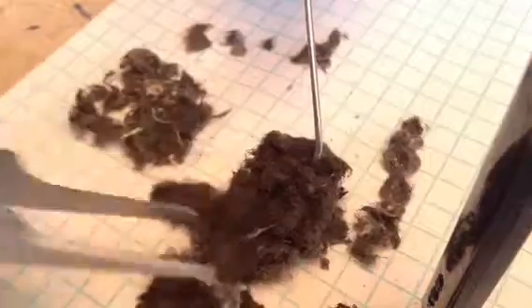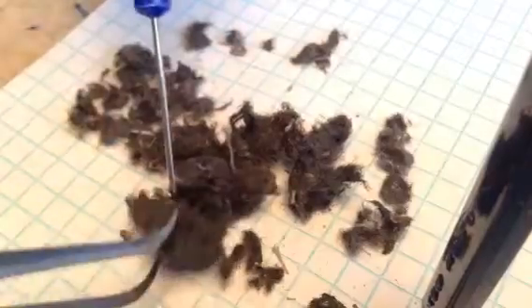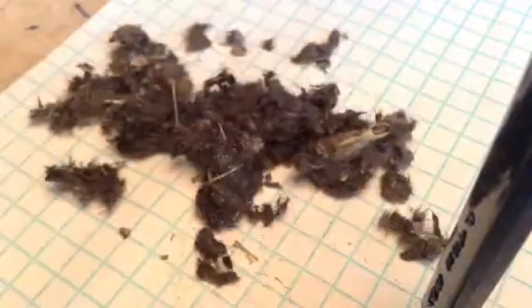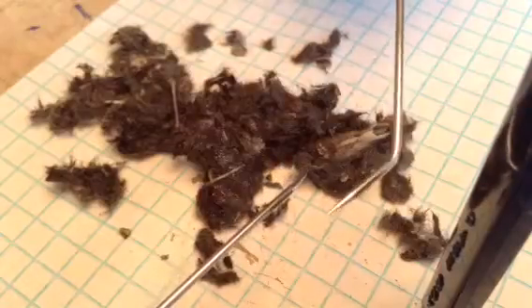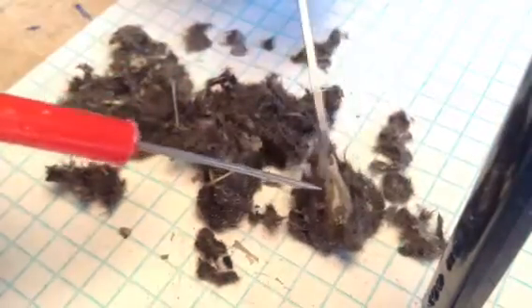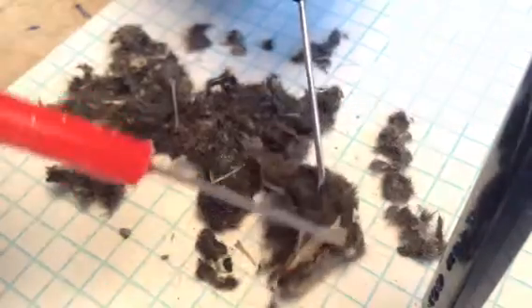Let's unwrap it. Flip this over. And again, every statement that I'm making here is not — or may not be — accurate, as I've yet to research this. I knew a little bit. Find that skull again — here it is. I'm going to use two picks for this one: a slanted pick and a straight pick. The picks are very good for getting out little details in the bones. It looks like that is a complete skull — jaws still intact.